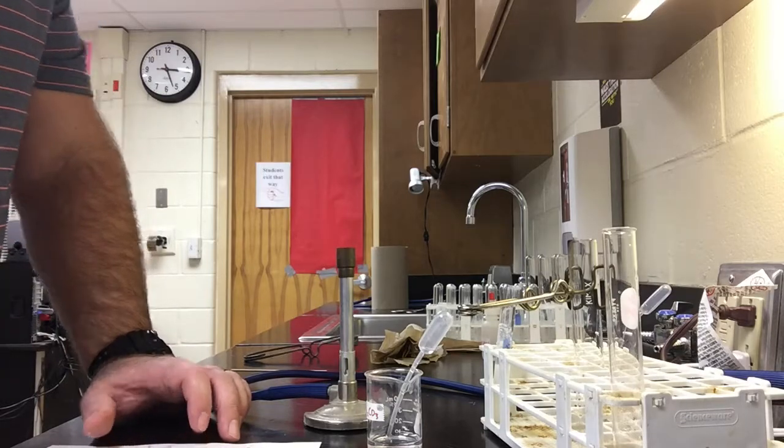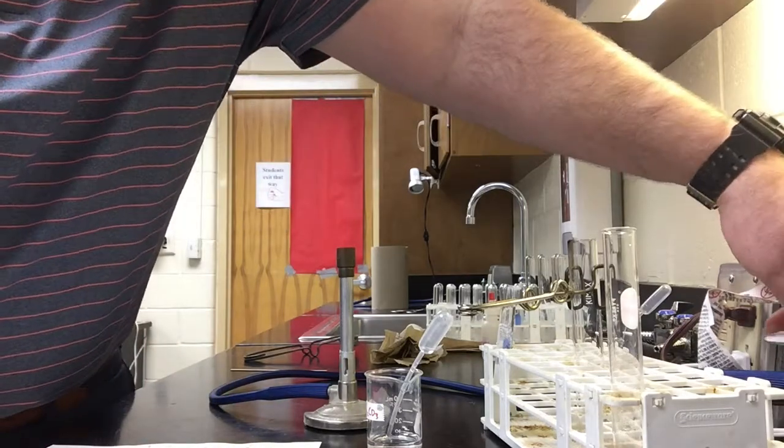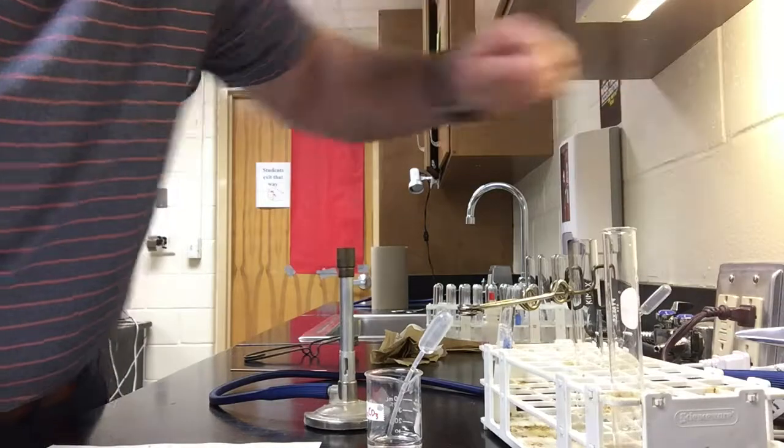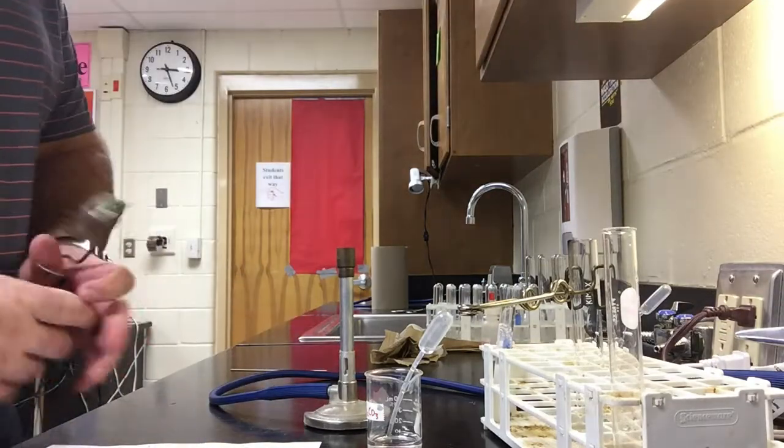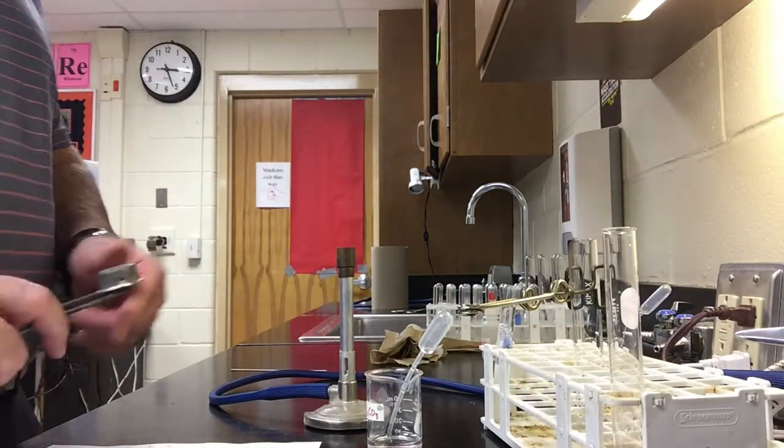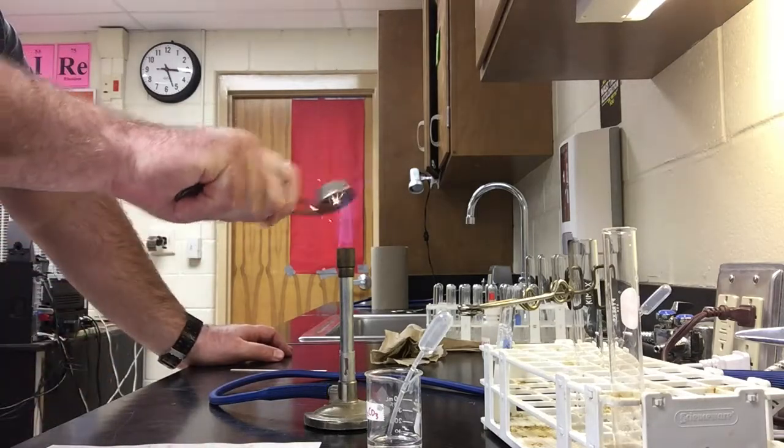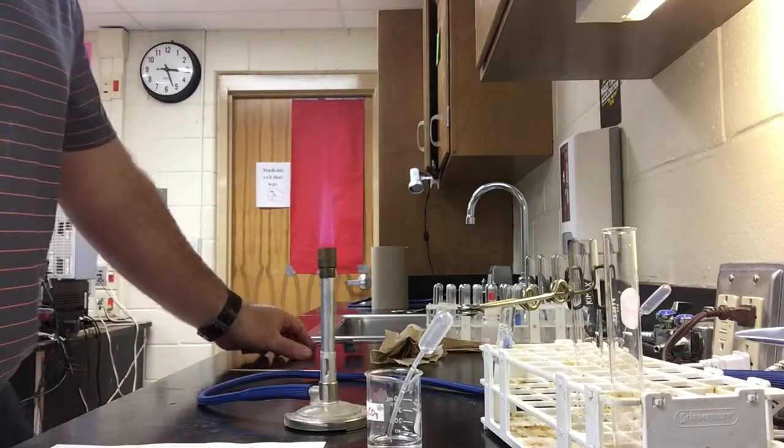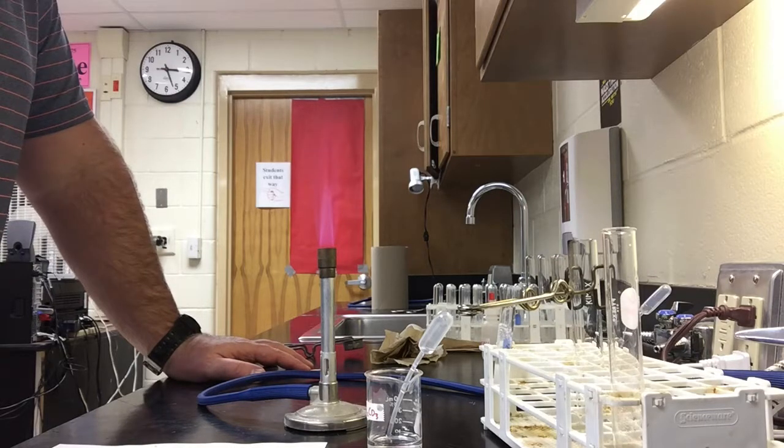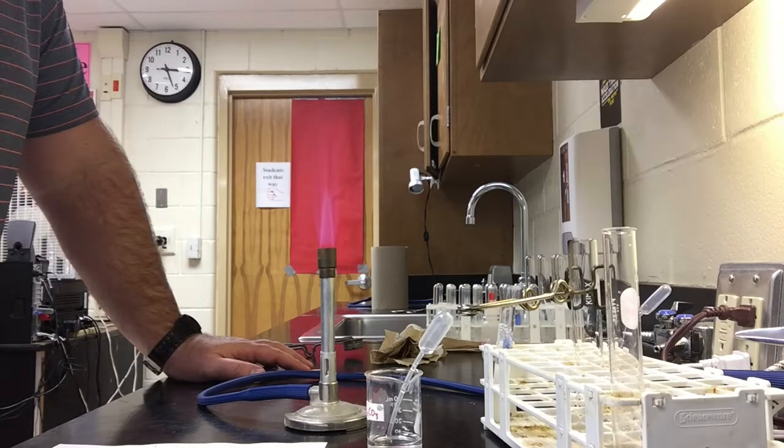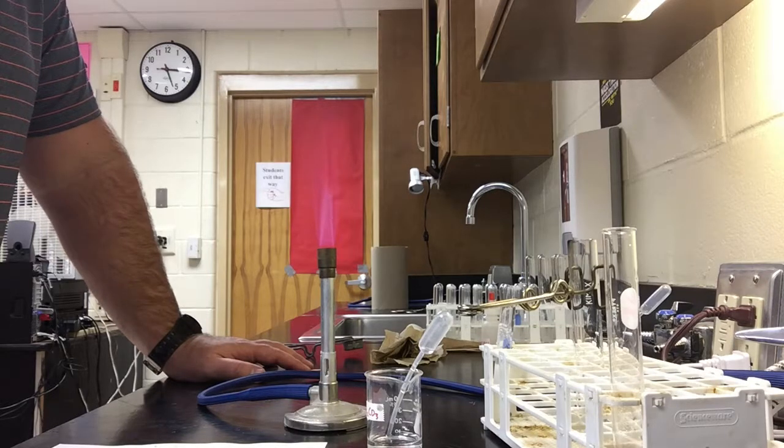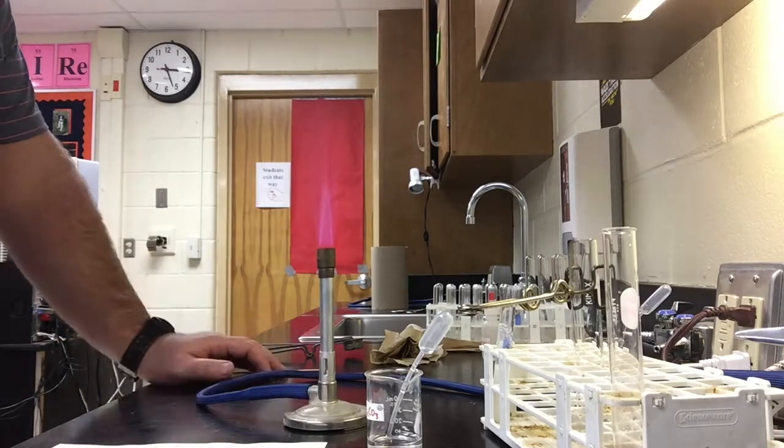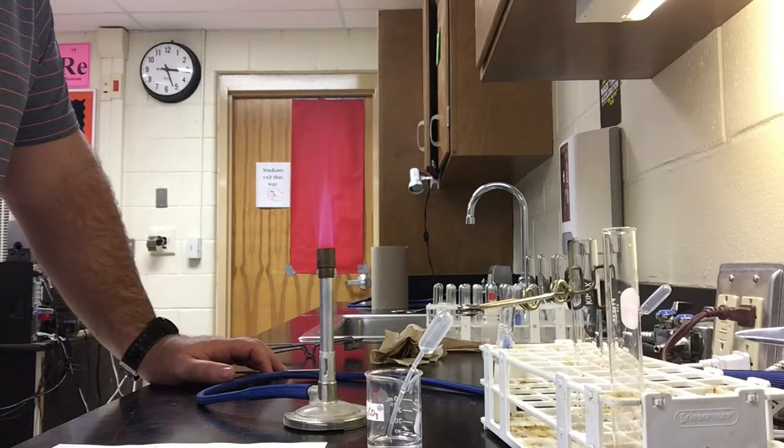Okay, and reaction E is combustion, which we've already seen the duration of the lab, but I'll show you one more time. Combustion occurs when I have a fuel, a hydrocarbon. In this case, my hydrocarbon is methane that's coming out of the Bunsen burner. When a spark is applied, combustion takes place. So right now I've got a combustion reaction of methane gas and oxygen gas that is producing carbon dioxide and water vapor. So a simple Bunsen burner, any kind of explosion, a flame, is certainly a combustion reaction.